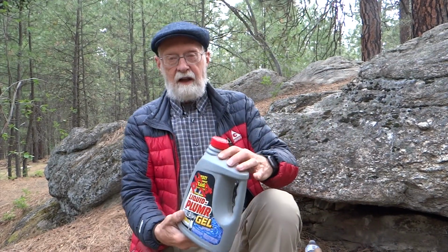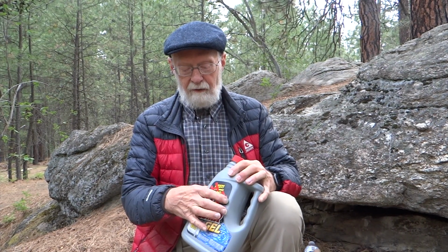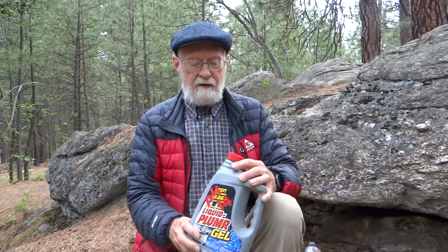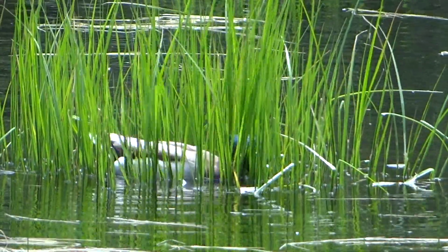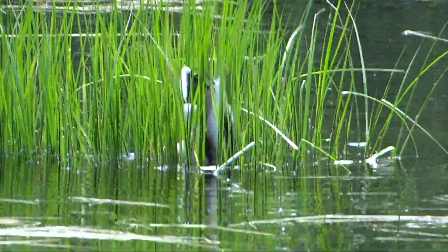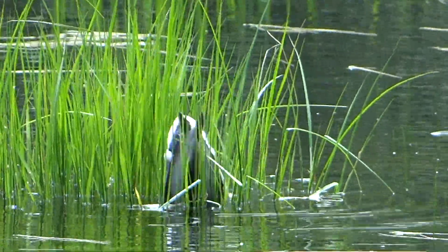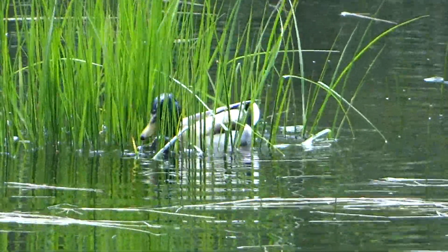The most alkaline things we have around are things like drain cleaner. This is a liquid drain cleaner that has a pH of about 14, which is very, very alkaline. Living organisms, like I said, like to be in the 6.5 to 7.5 range. When we do testing on water, like the ponds and springs here, we look at pH as one of the things we measure, because if it's outside of that range, it probably means there's some sort of pollution going on, and it's going to make it hard for organisms to live there.